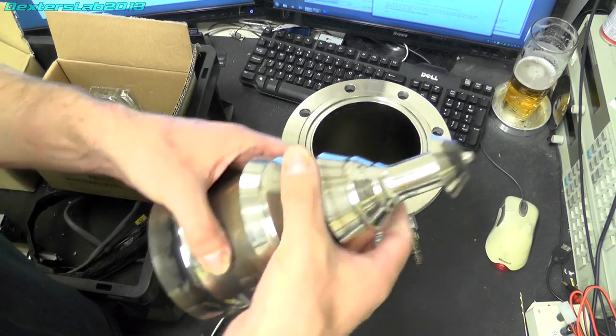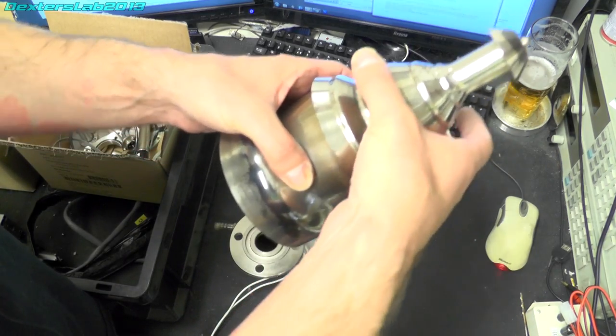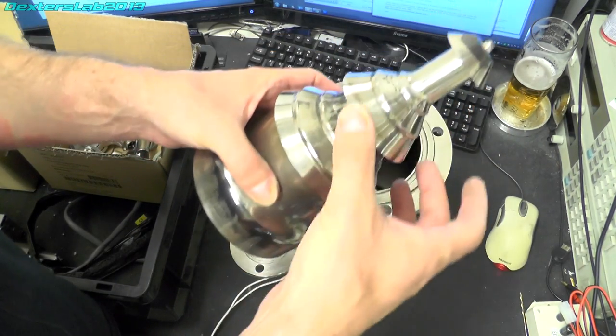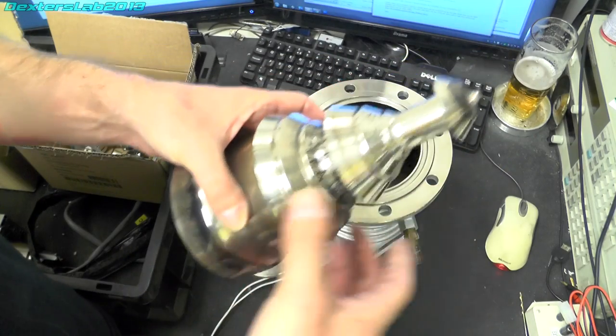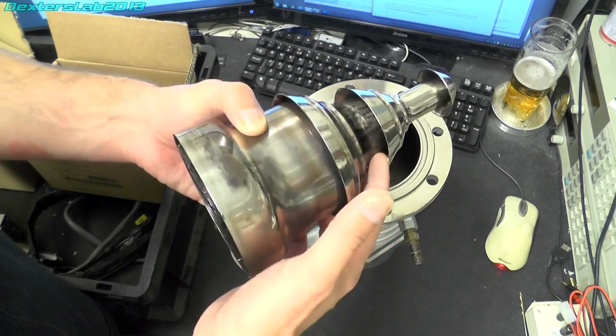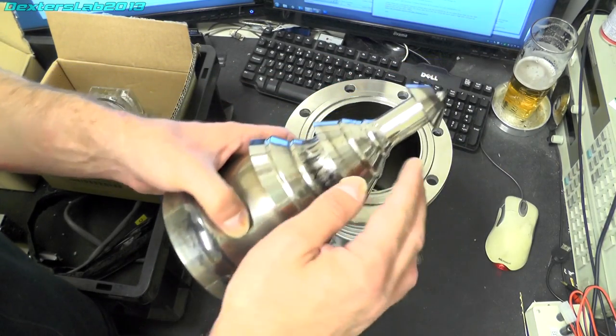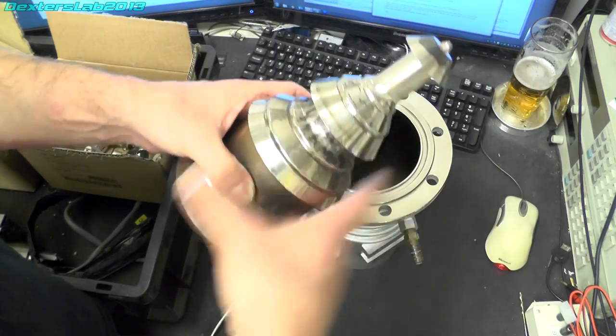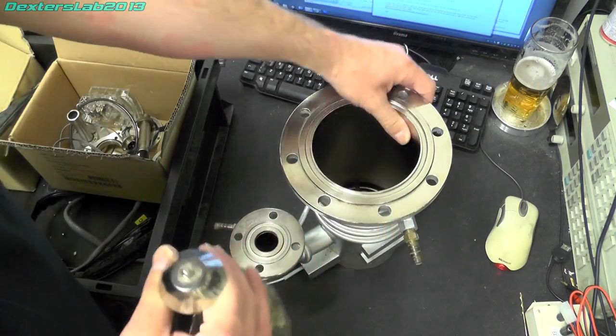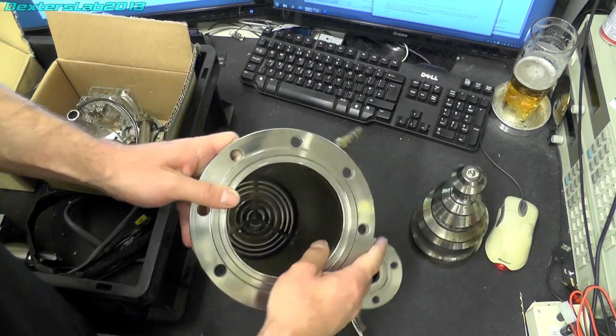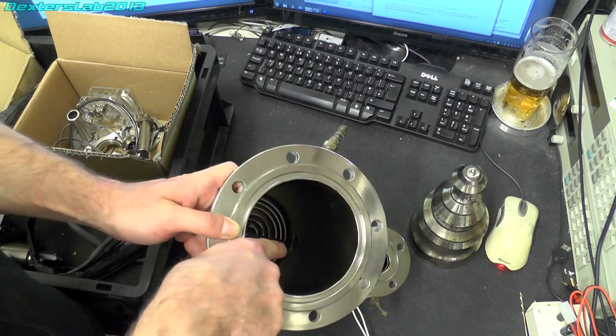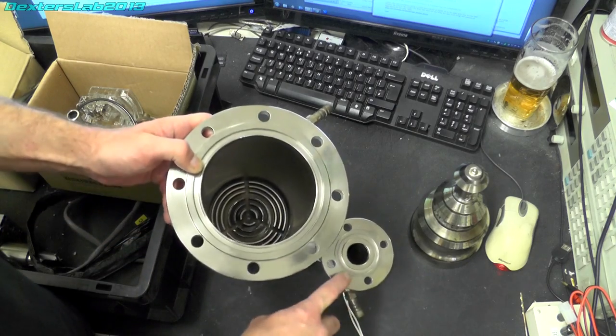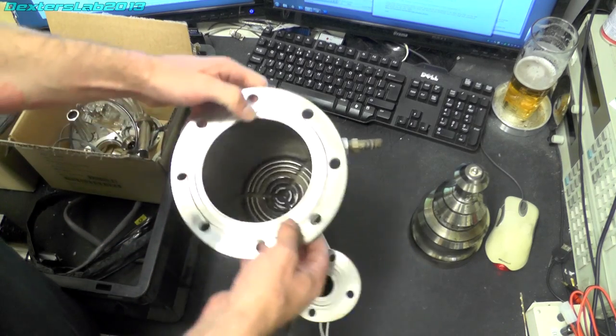Which actually sprays or effectively sprays a mist of the oil coming downwards out of this gap here and this one here, blowing downwards into the exhaust port which is just down in the bottom there, which then attaches to this part here.